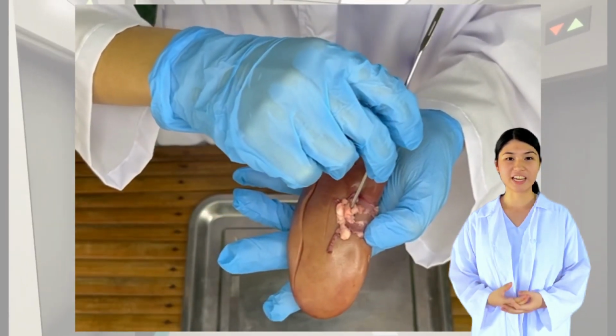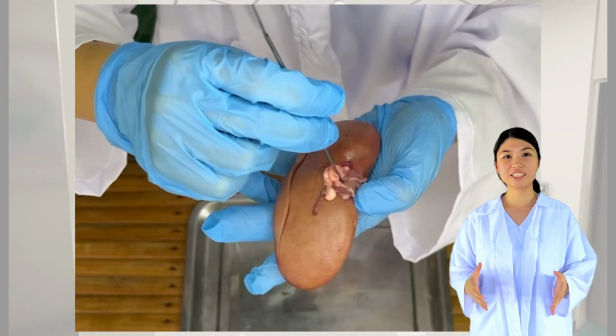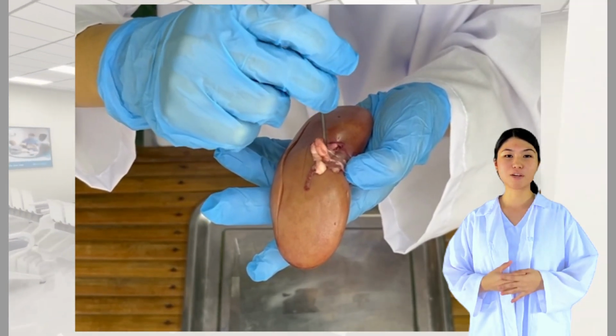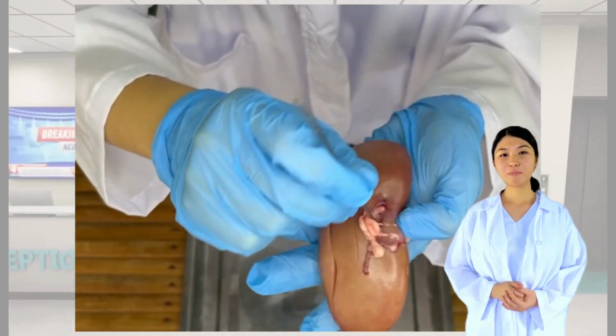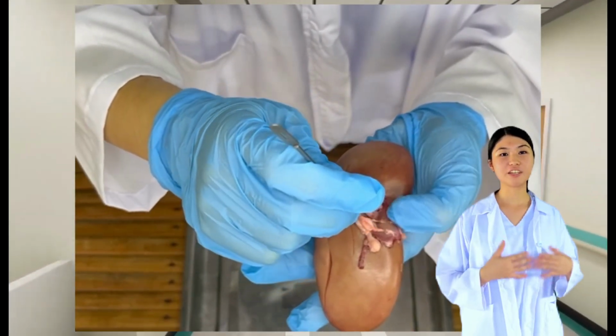On the other hand, the renal vein has a much thinner wall, as you can see by its flexibility. Aside from that, the renal artery also delivers blood containing waste and excess water to the kidney, while the renal vein transports the purified blood that has left the kidney back to the general circulation. In the process, waste is transported by urine and leaves the kidney via the ureter.